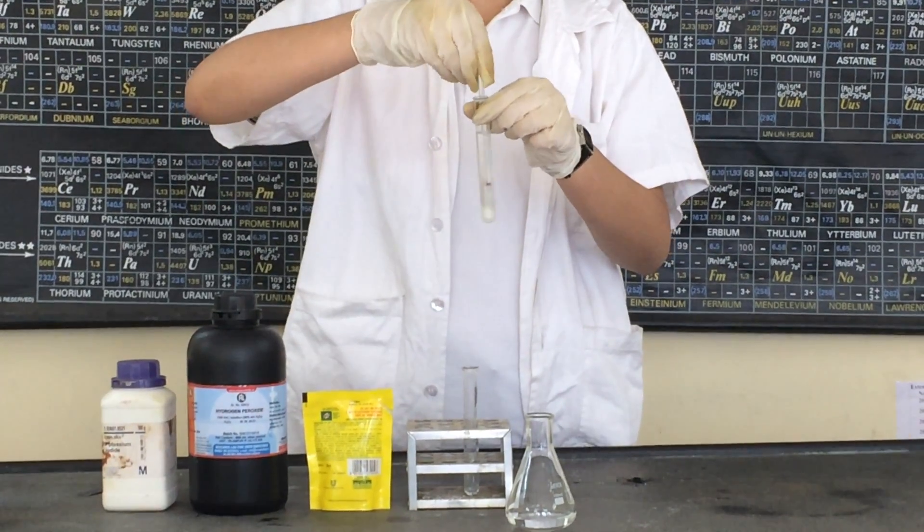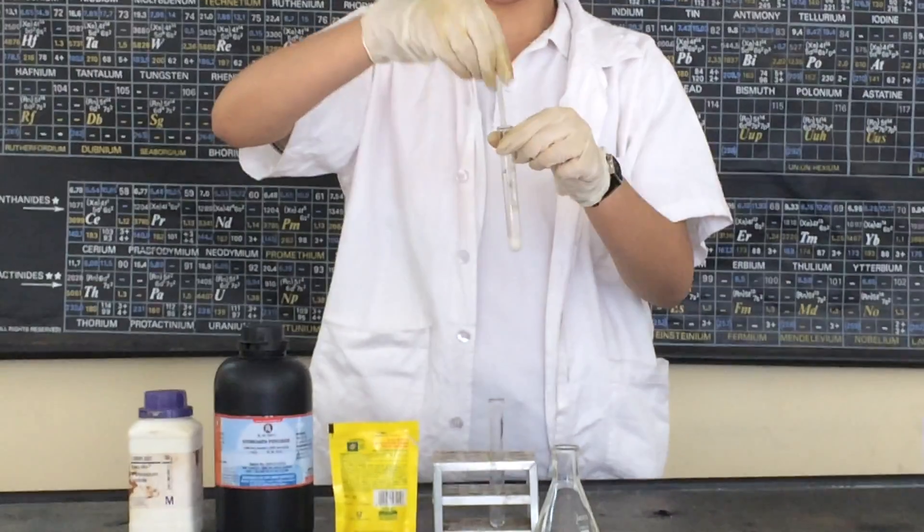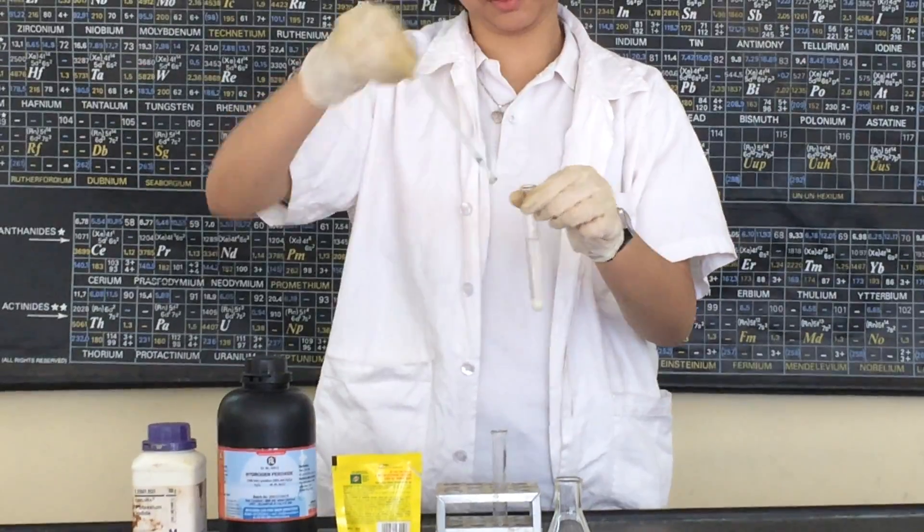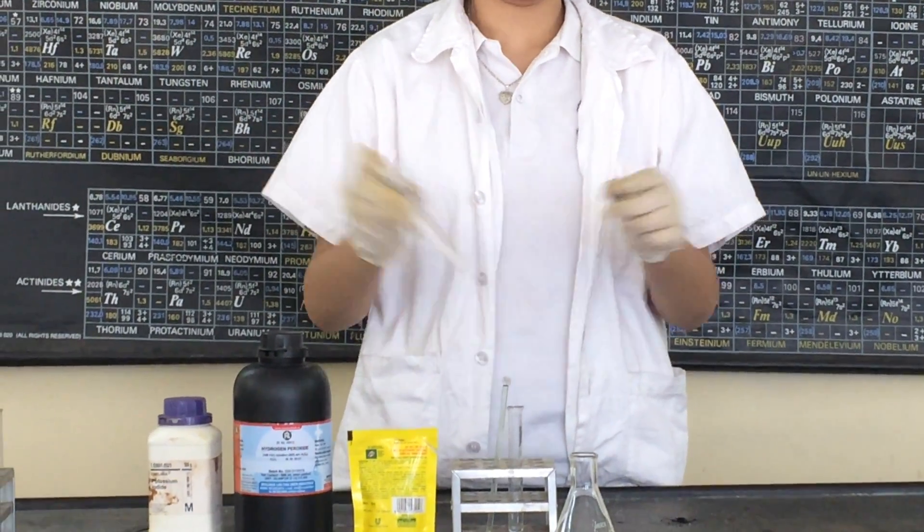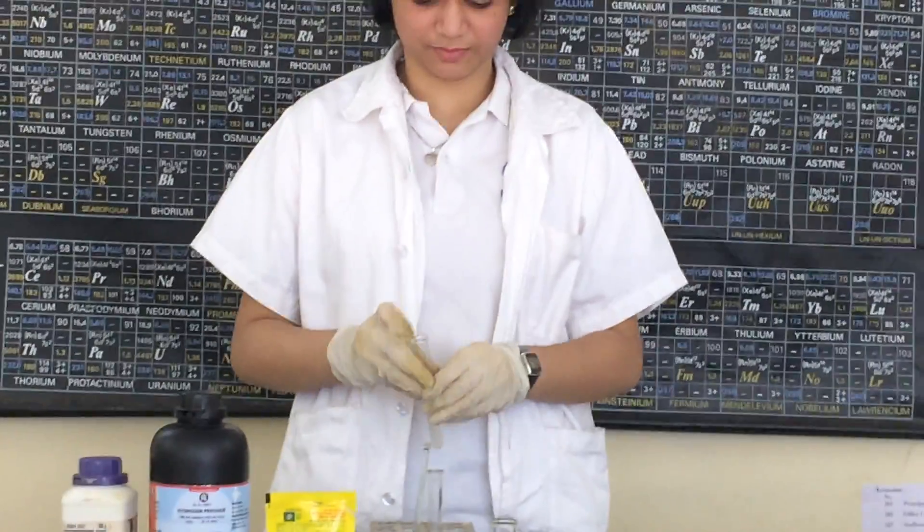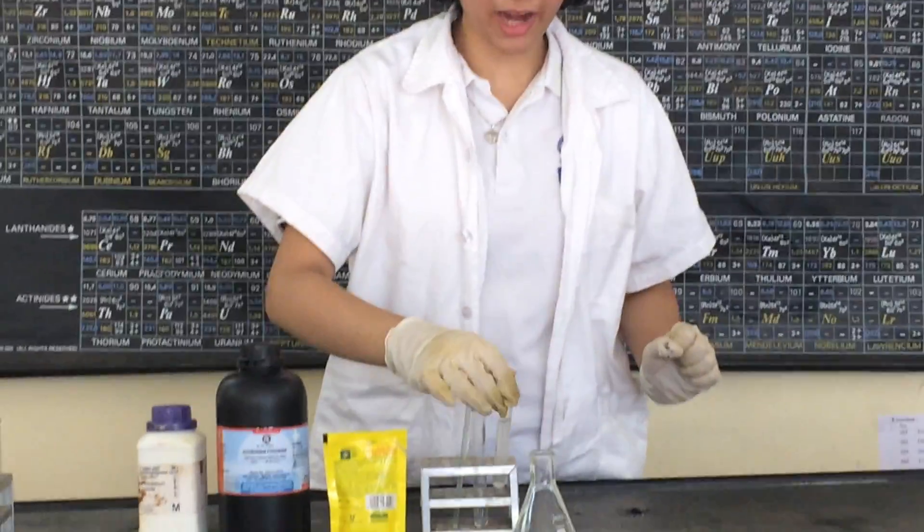I will stir it for a few seconds. The solution of potassium iodide is prepared.